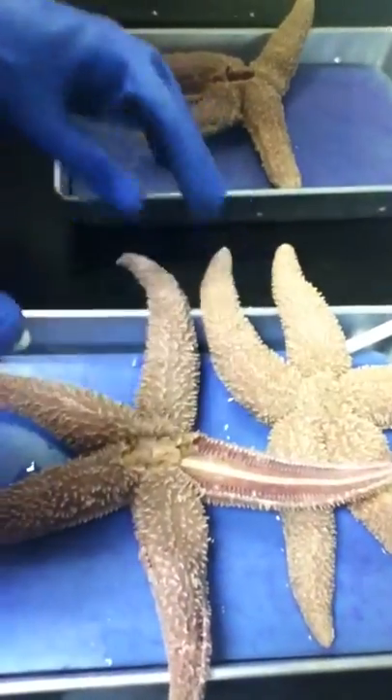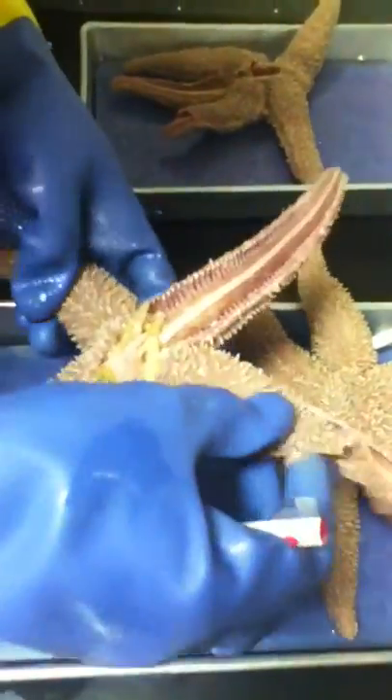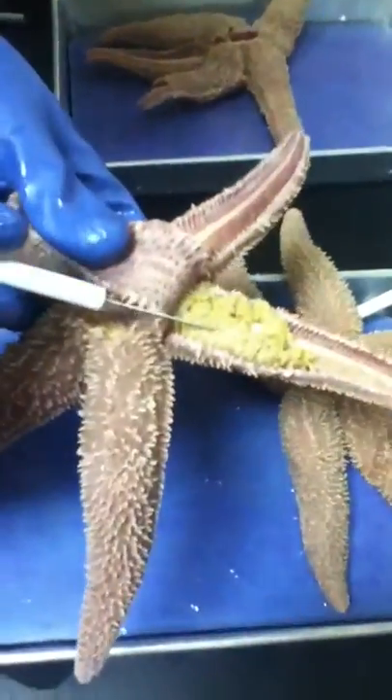Ooh, I didn't get the right one out that had all the digestive... It does. I opened it. It's one of the... yeah, good. Digestive glands. Digestive glands.